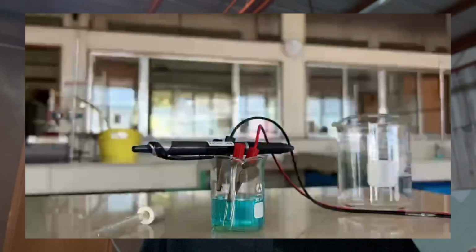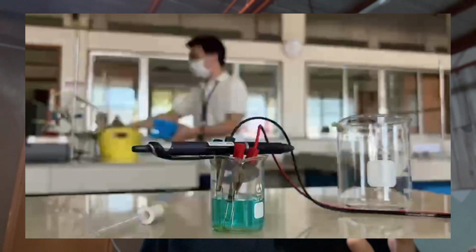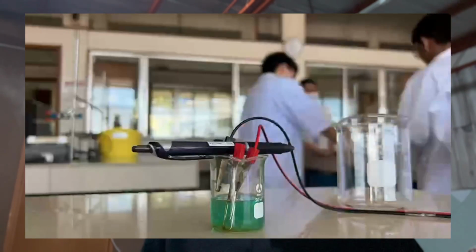As the reaction continued, the blue water slowly turned greenish, and rust-colored sludge formed from the pins. The rust is actually iron hydroxide, and it works like a sticky magnet that traps the dye molecules and other impurities. So the color change means that it's working. Yes, after about 10 to 20 minutes, most of the color disappeared. Then we filtered the treated water again through sand. The filtrate was much clearer.